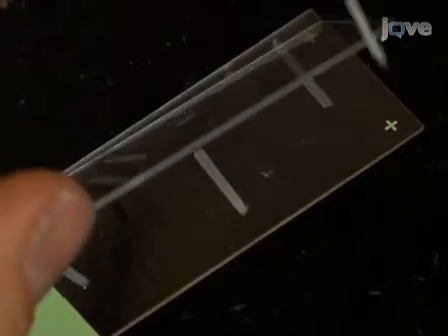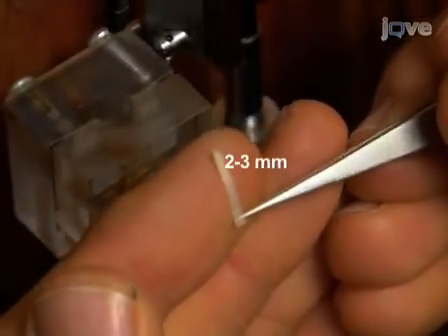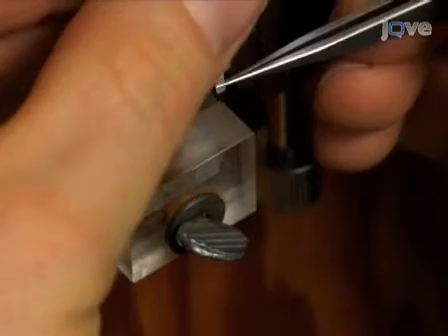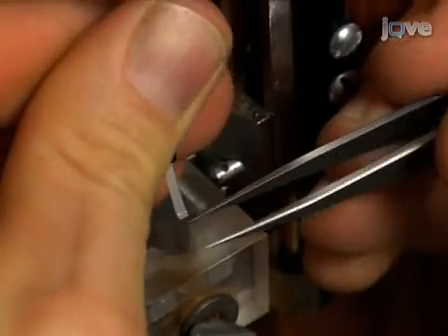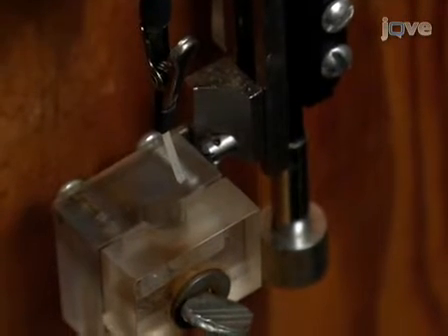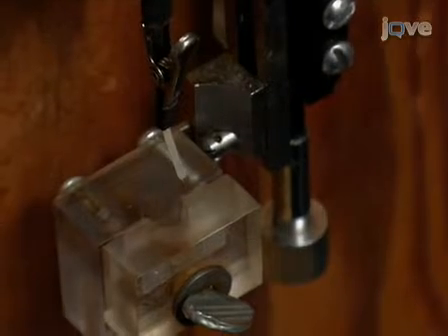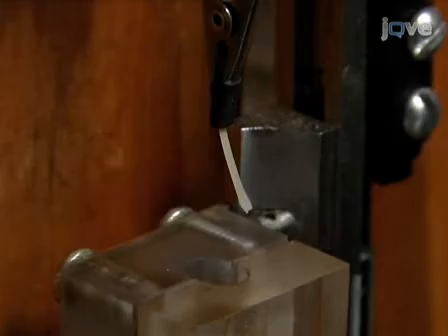To prepare samples for measurement of cell wall expansion, the basal end of the hypocotyl sample is picked up with fine forceps and approximately 2 to 3 millimeters of the apical end is placed in between the open jaws of the movable clamp. This clamp is a spring-loaded alligator clamp. The metal jaws are coated with plastic to prevent direct contact between the metal surface and the buffer solution or the wall sample. In our experience, metal ions can leach from the clamp and inhibit the wall's ability to extend, and so we keep the metal covered.